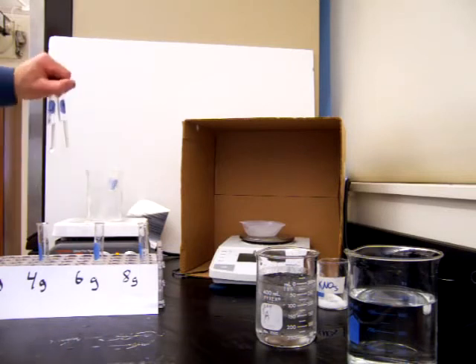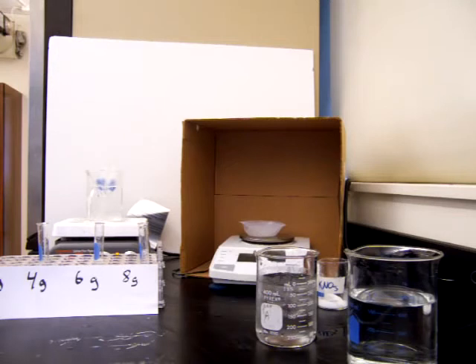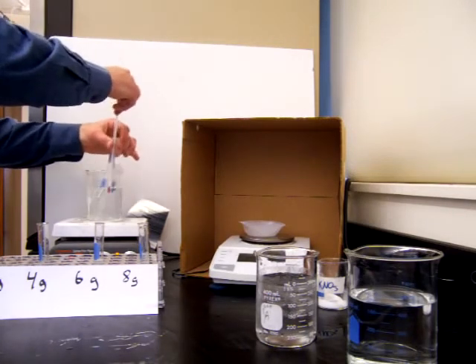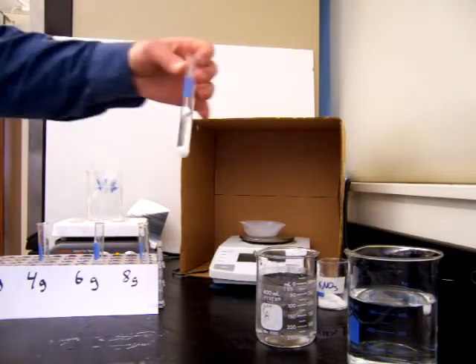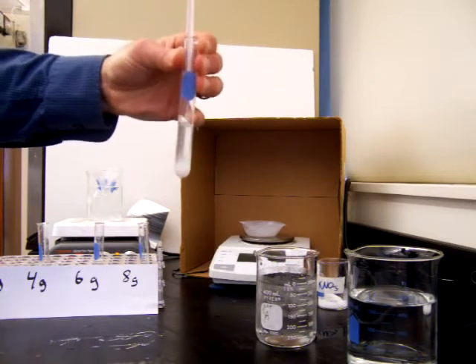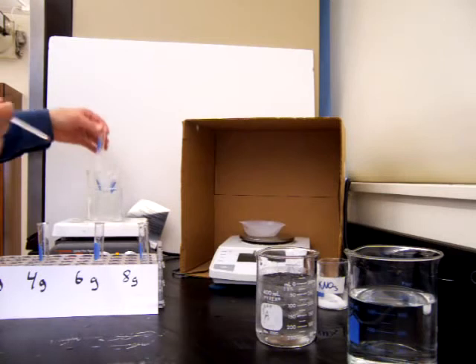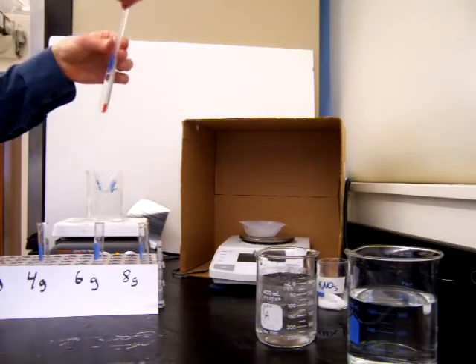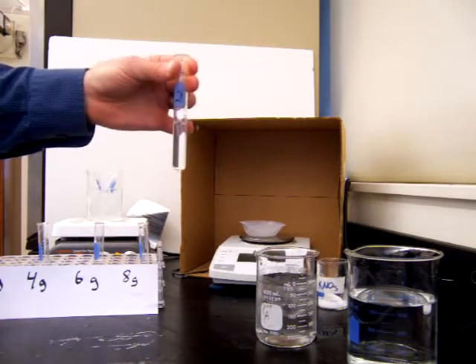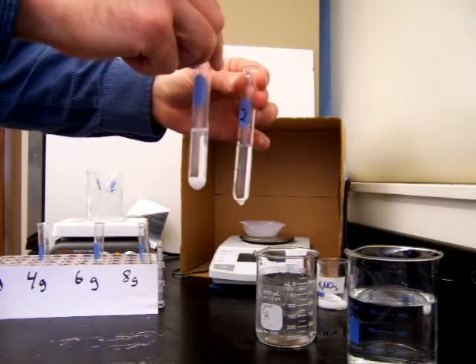So I'm going to take the test tubes, I already have some set up from earlier, and put them into a hot water bath. And in the hot water bath, we're going to stir these solutions until the salts have completely dissolved. So this is what the salt crystals look like before they've been dissolved. You can see the little particles still in the solution. And then after we've heated them in a hot water bath for a little while, they'll look like this. So all the particles have dissolved, and you have a solution. In the solution, you cannot see any of the salt particles. Before they're entirely dissolved, you can see the salt crystals.